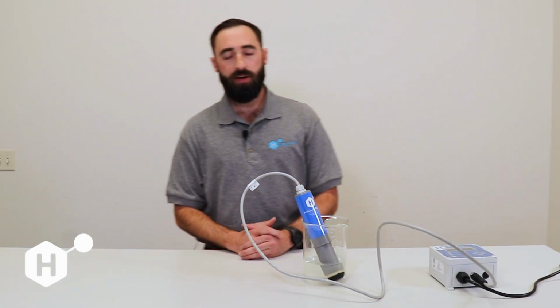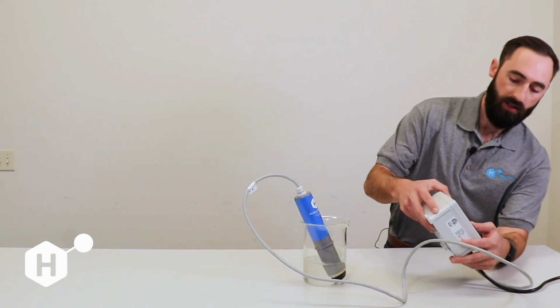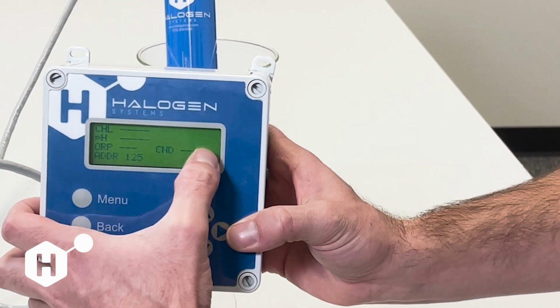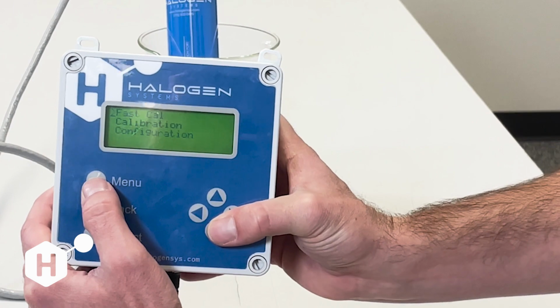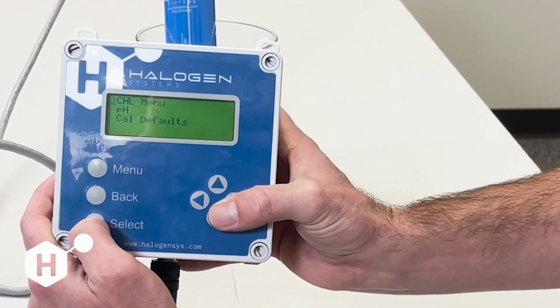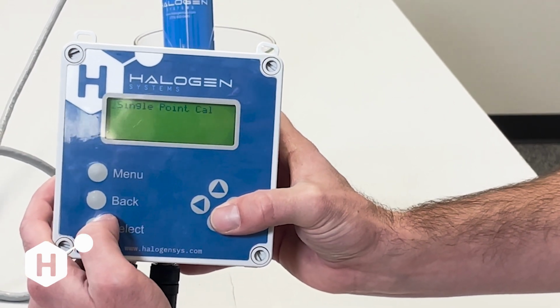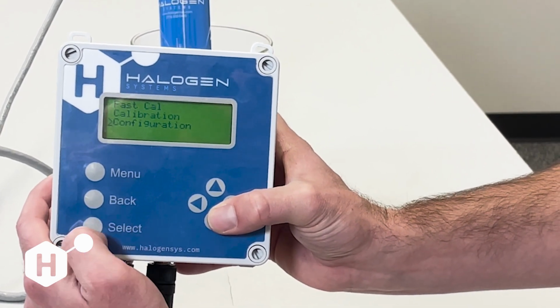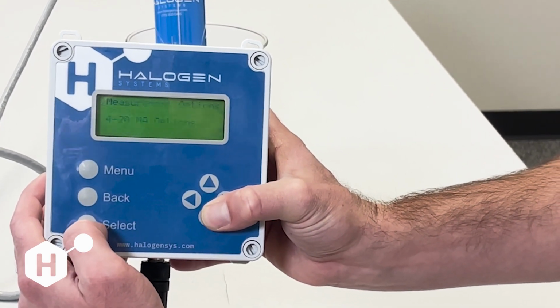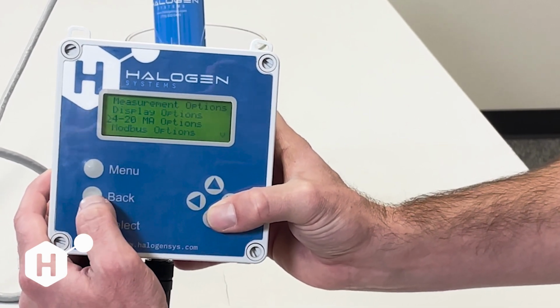The next thing that we're going to cover is some of the more long menu functionalities that we have. As you can see here, we are in the short menu right now because there is no L in the right-hand corner of the screen. And you see that we only have 3 menu options. We also have just pH and chlorine calibration ability here, and we only have single point pH calibration here. And then our configuration here is going to be a little bit more limited and only have 4 to 20 milliamp options and not 4 to 20 calibration.